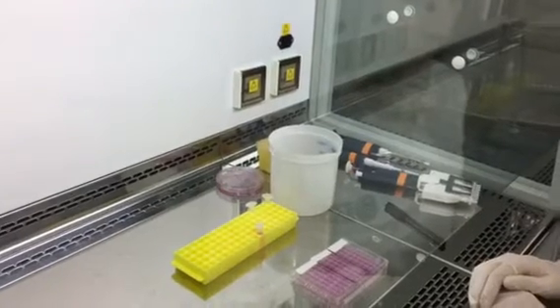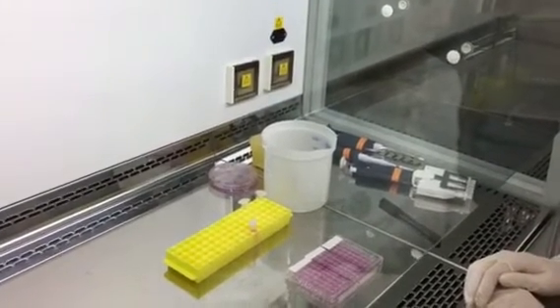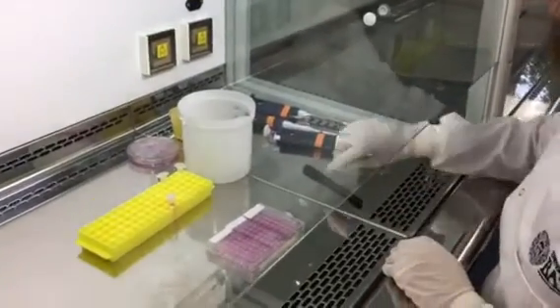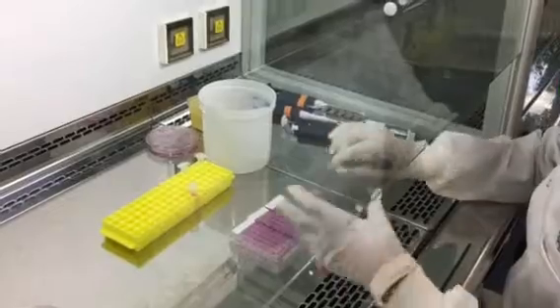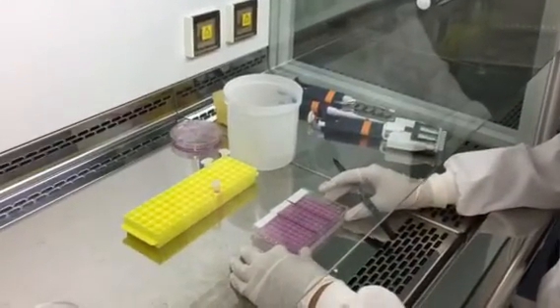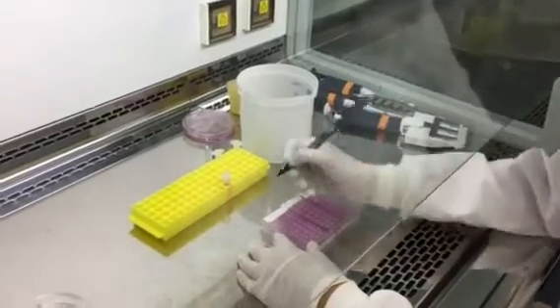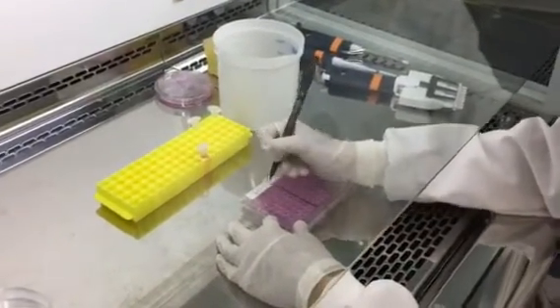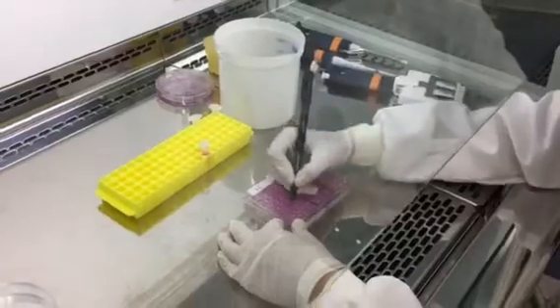Remember the stock is 100 millimolar and you want 1 mL of this drug. Once that's done, you start with your cell culture plate — here's your 96-well tissue culture plate with your specific cell line. You start with labeling the plate first with your initials, so this is for the pair of you.